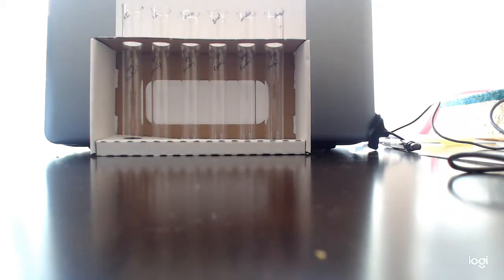I'm recording your video for your exercise, I think 7 in your Odigio labs. This is the biological molecules lab, and what we're doing is running biological molecules tests to confirm the presence or absence of biological molecules such as proteins, carbs, lipids, or nucleic acids in different substances or food groups. And what I'm going to run now are the control experiments.